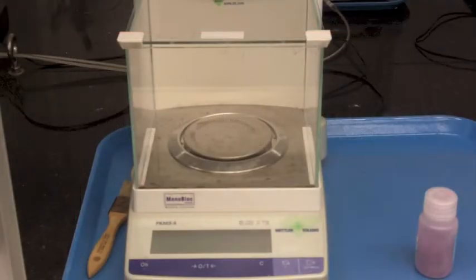This is our balance. It goes to the nearest milligram and has glass enclosures with a lid. We have about six of these on each side, so there are plenty. You'll notice there's also a brush there and a number of different things.